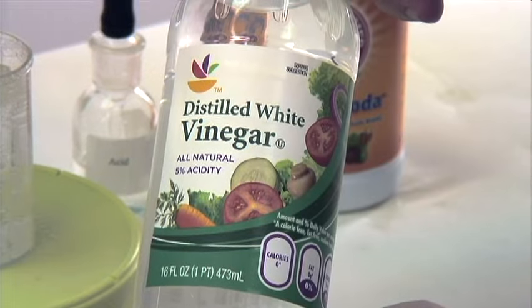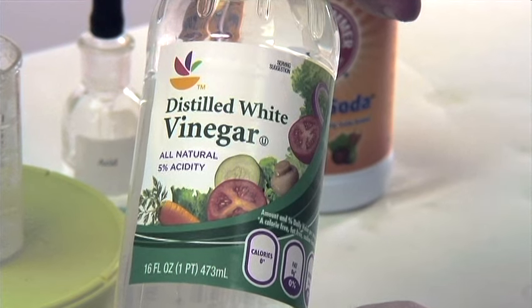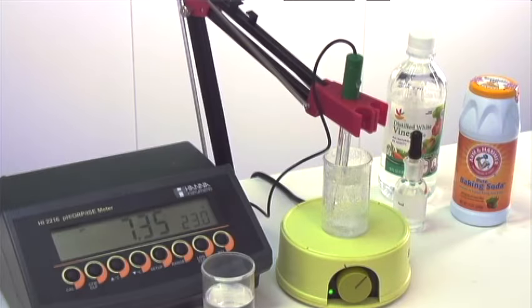We're using 5% vinegar. If we had vinegar that was 10% acidity, it would have been the same pH, but it would have only required half the amount of vinegar to change the pH of the DI water or the DI water with the baking soda.